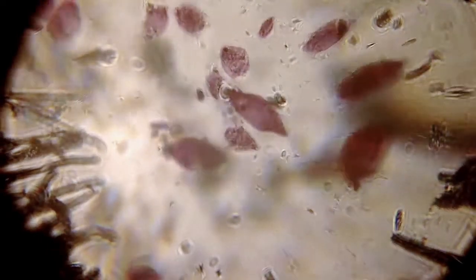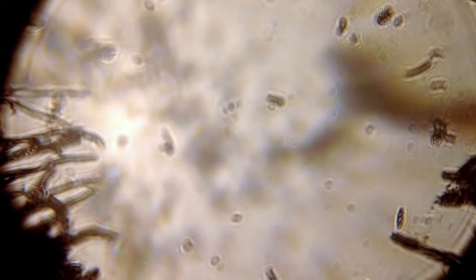And you can see the different, just a second, find a nice little batch. There's a nice one. You can see the parabasalan hypermastigotes there. Those big ones in the middle that are kind of teardrop shaped are Pseudotrichonympha pearti. That's named after the drummer from Rush. Make taxonomy fun again. Okay, oh yes, the light source, just a cheap IKEA light, but you need something pretty bright or you get a kind of a dim image.